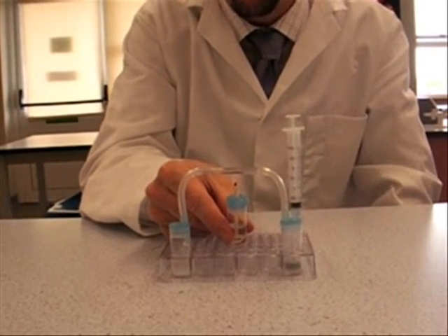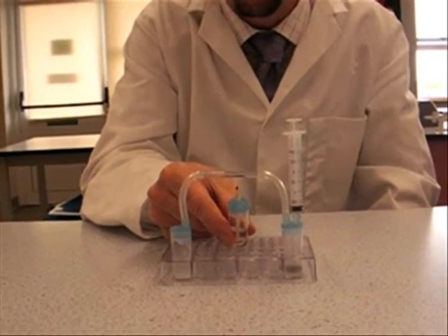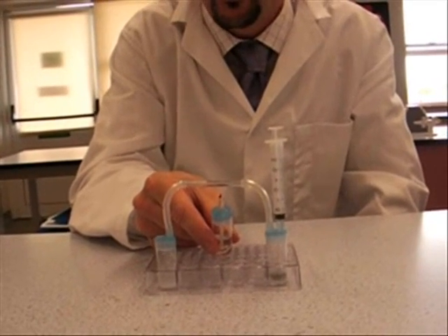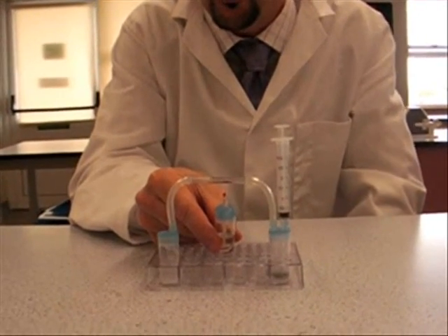At the end of this experiment, you need to heat it for about two minutes. After two minutes you should have a good result. And we'll be judging on how much copper you've actually managed to make.